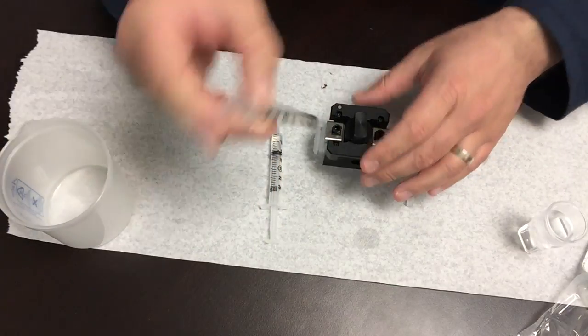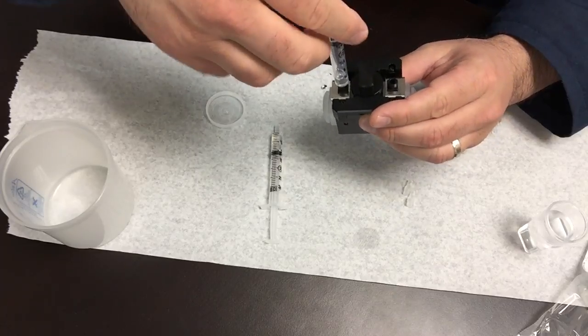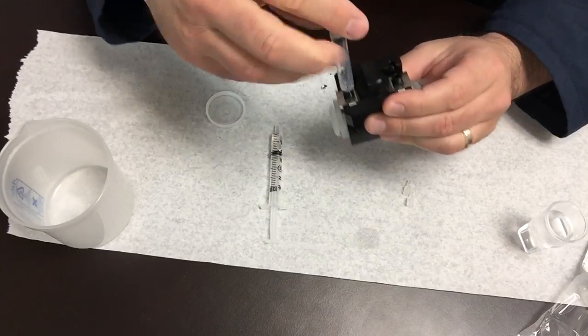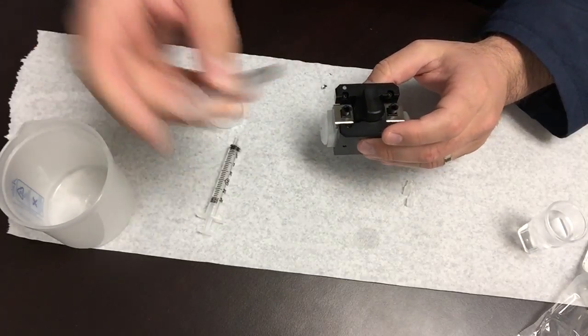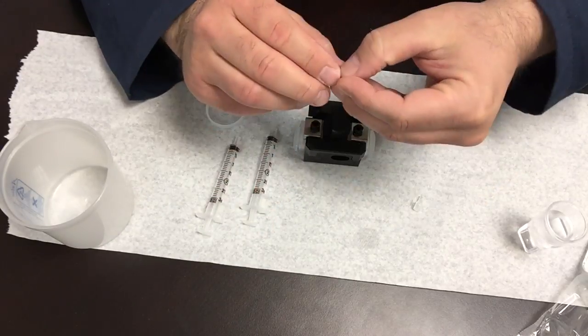Take an empty syringe like this and then pull the sample out. You can also get some clean syringes and flush it out with water afterwards to make sure that it stays clean.